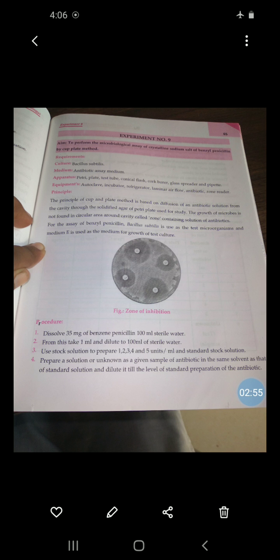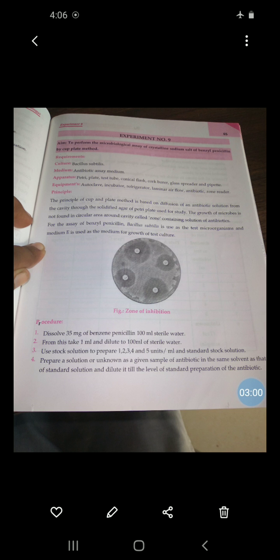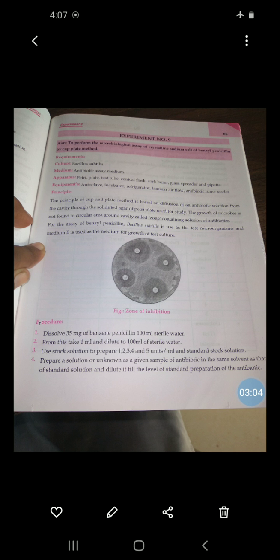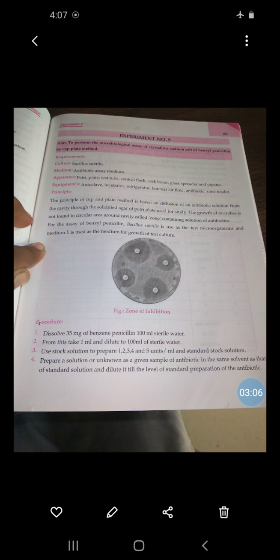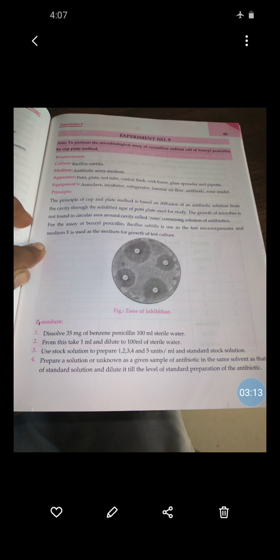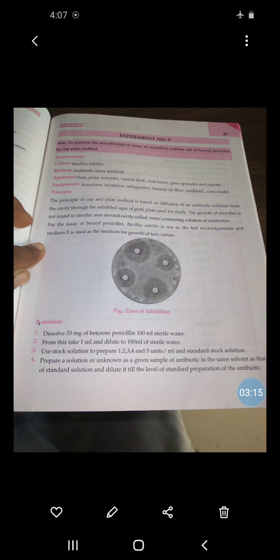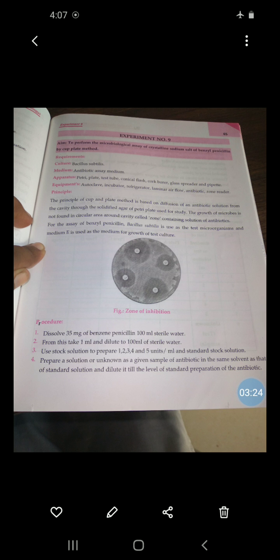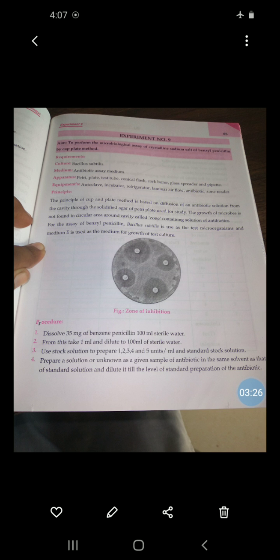From this stock solution, take 1 ml and dilute to 100 ml of sterile water. Then use the stock solution to prepare 1, 2, 3, 4, and 5 units per ml standard stock solution. Then prepare a solution of the unknown sample of antibiotic in the same solvent as the standard solution, and dilute it to the level of the standard preparation.